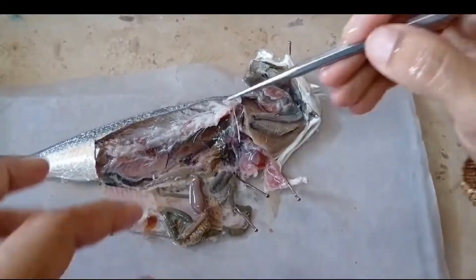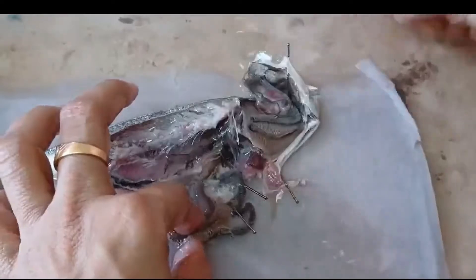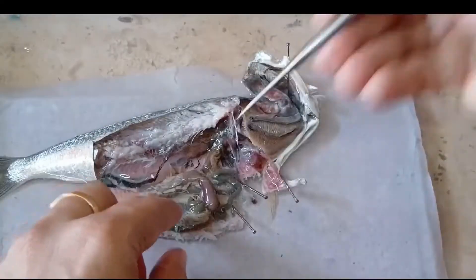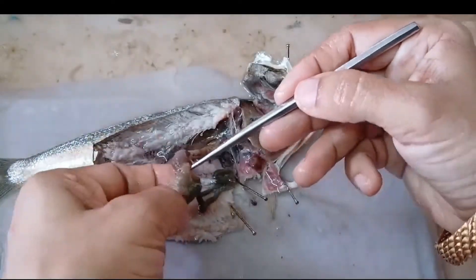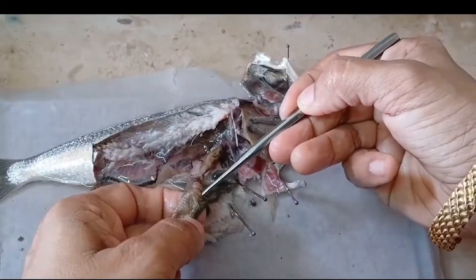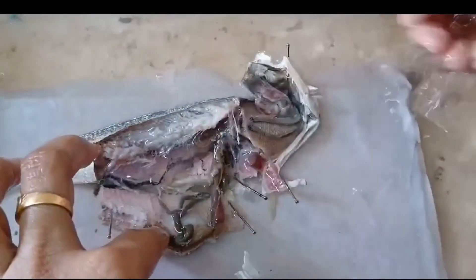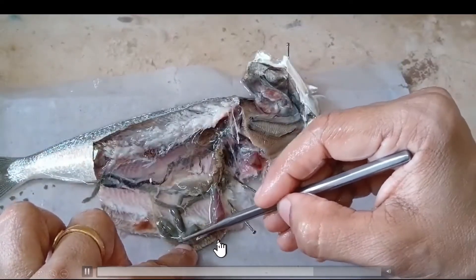This flushing of water is certainly helping us to uncoil. Here we can now clearly see the pyloric caeca in this portion.